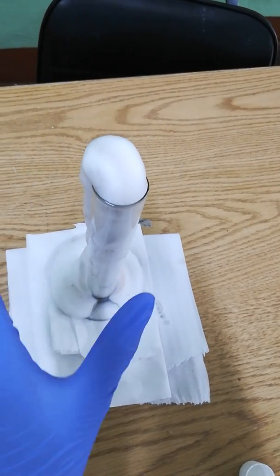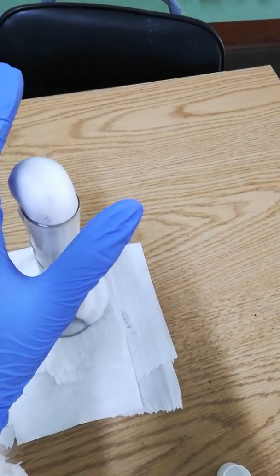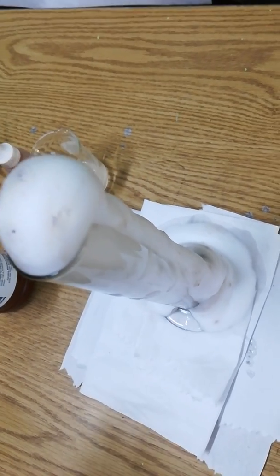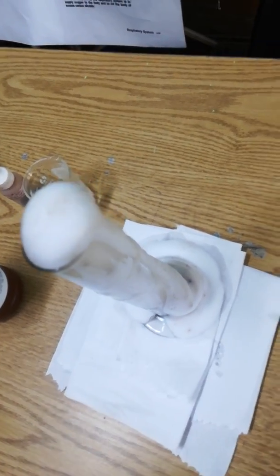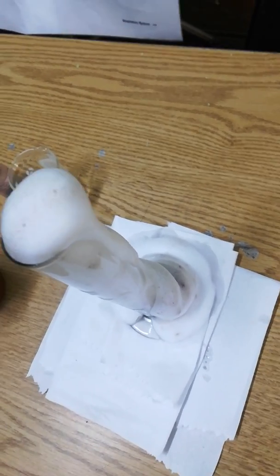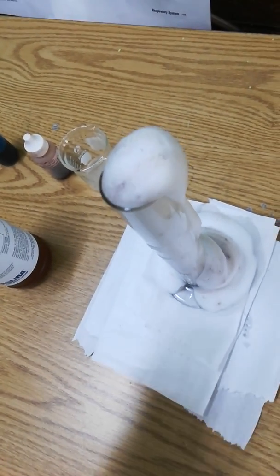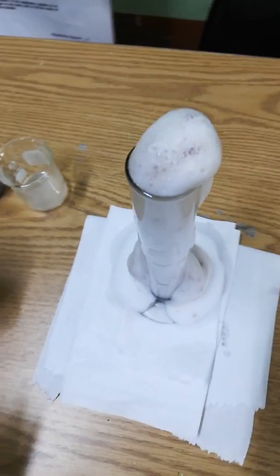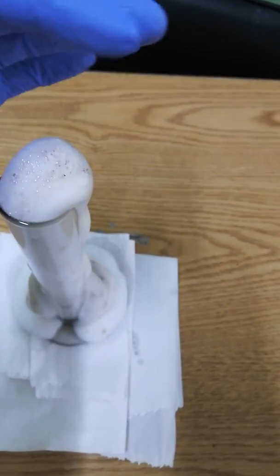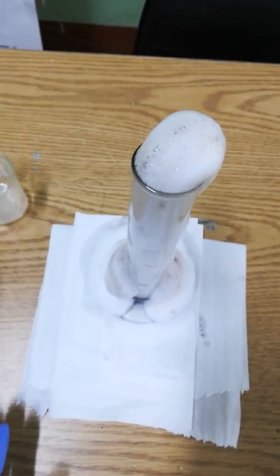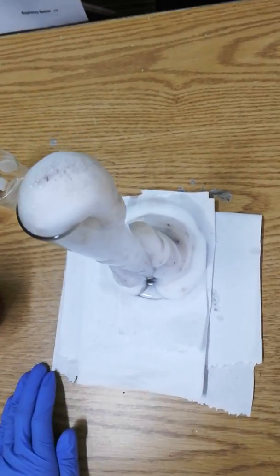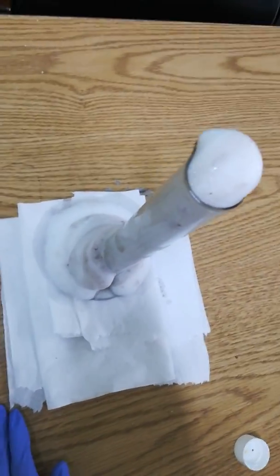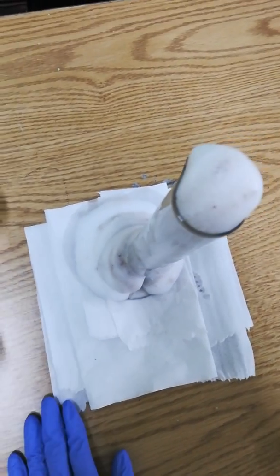It should have been a lot more vigorous, but to explain what's happening now: the hydrogen peroxide, which is H2O2, is being decomposed into water, which is H2O, and oxygen gas. The oxygen is being given off very rapidly and there's also a lot of heat coming off, so it's an exothermic reaction. It's a lot cooler if the process was faster, but it's still good to see.